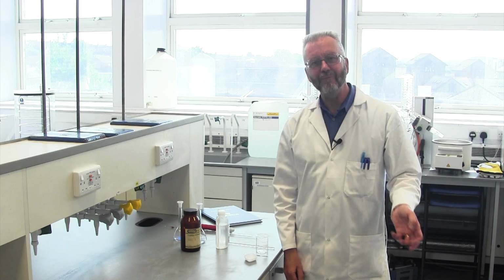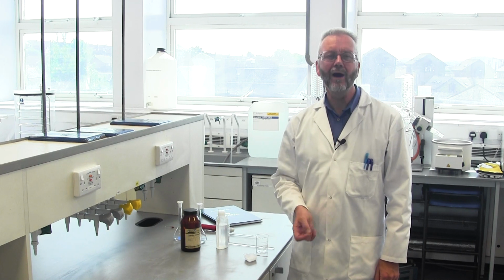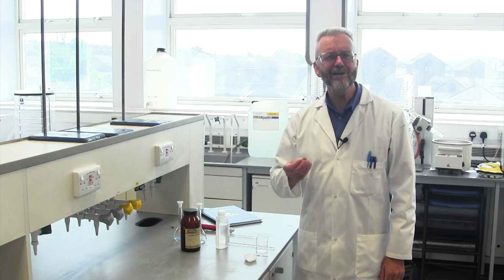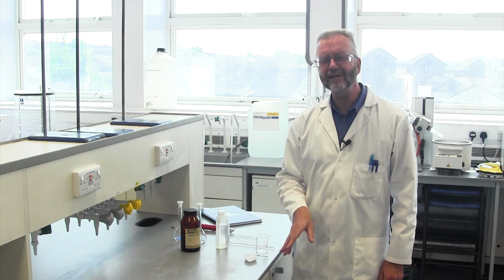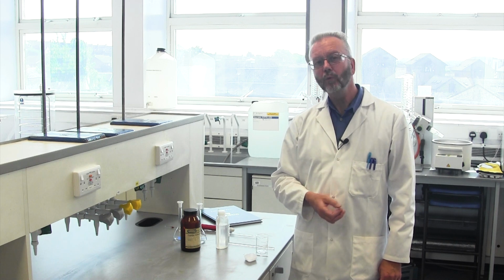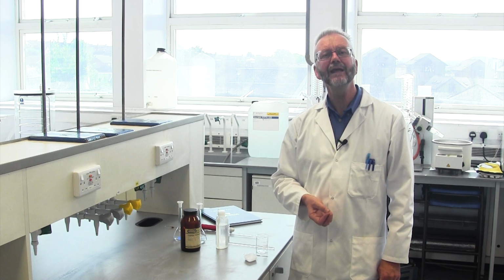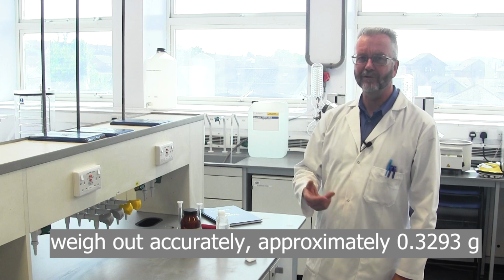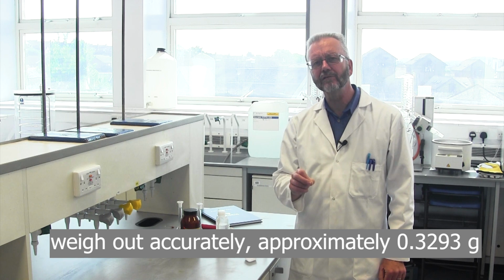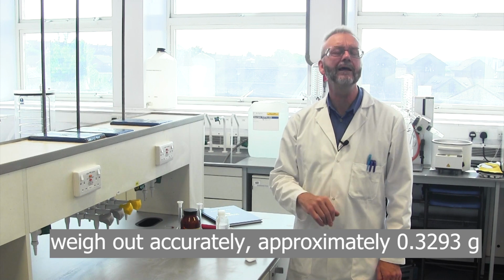So here we are in the lab with the necessary equipment. Our first job is to weigh out the required quantity of compound. To weigh out exactly to the nearest 10,000th of a gram will be extremely time consuming and near impossible. To get around this, we'll use a phrase that can be confusing when you first see or hear it. It is weigh out accurately, approximately. The key here is the comma between the two words. If you read out the phrase, putting a pause where the comma is, it becomes clearer.